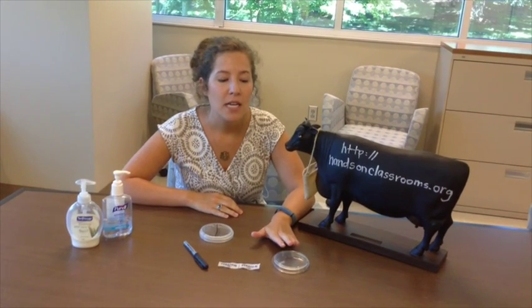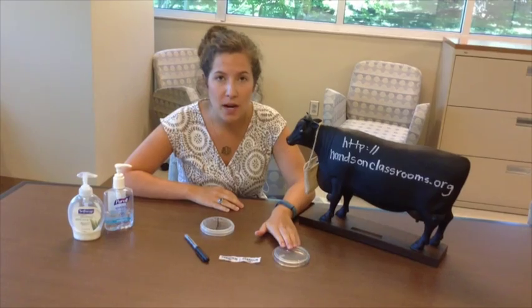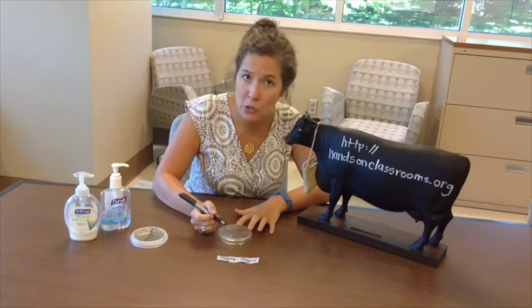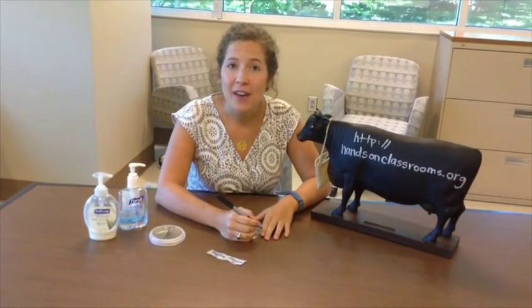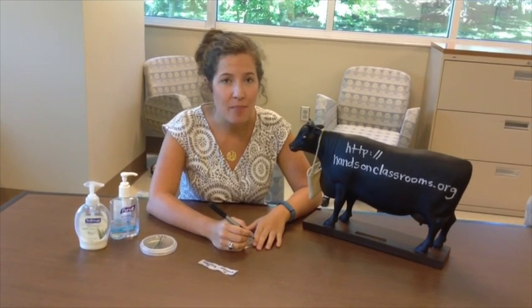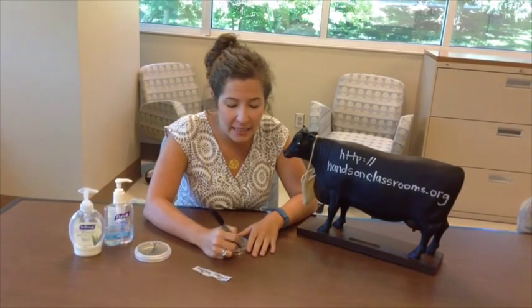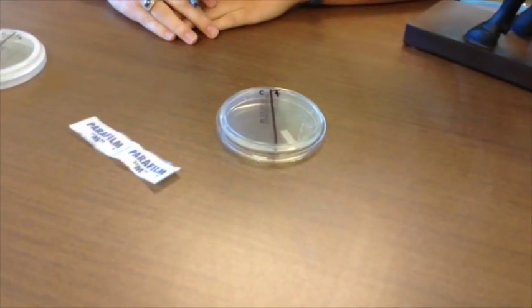It's important to keep in mind that you will be writing on this plate, and to always write on the base side. You need to divide it into two sides because we have a control and a treatment. So we divide our plate in half. After dividing, we'll have both a control and a treatment side: the control side is represented by a C, and the treatment side is represented by a T. Make sure they're fairly small because we want to be able to count our bacteria by the end.